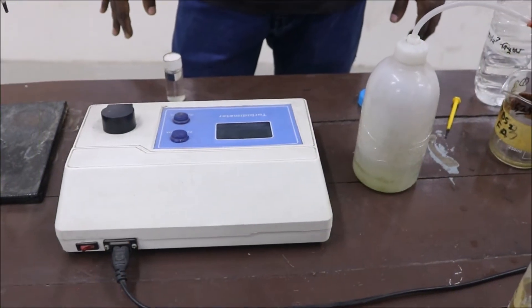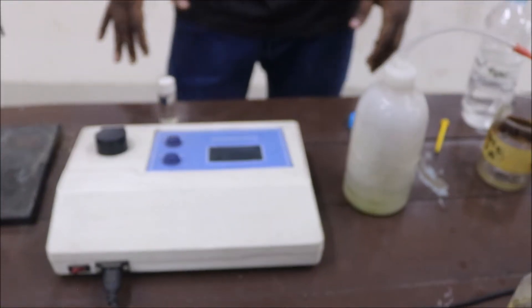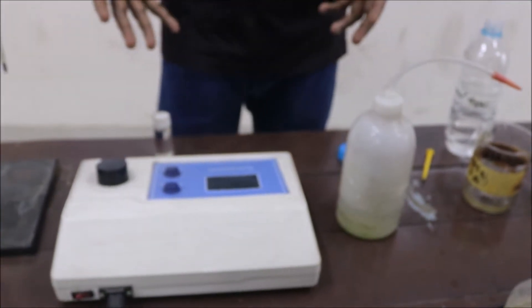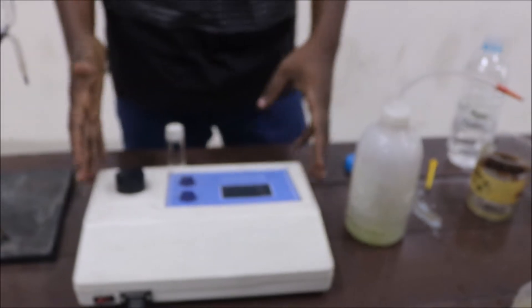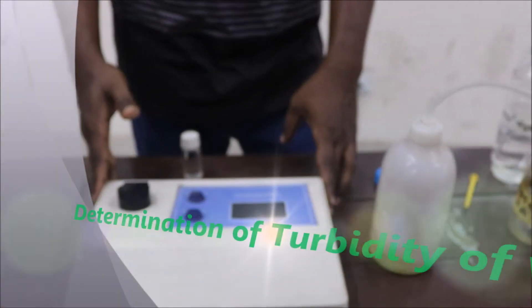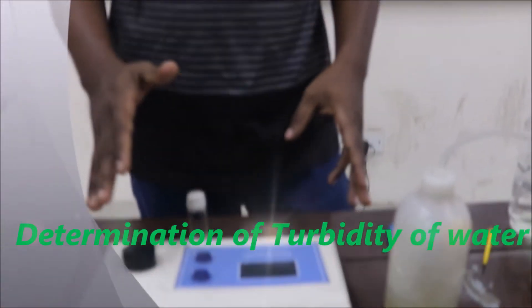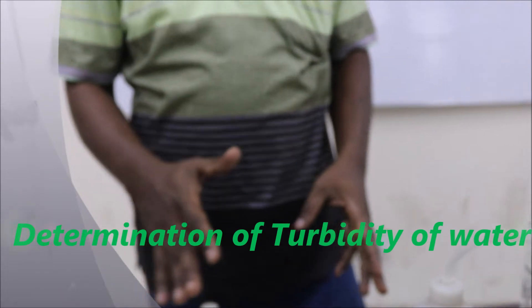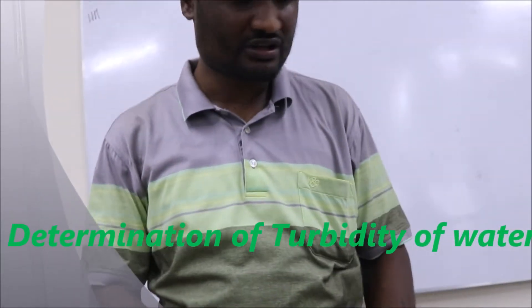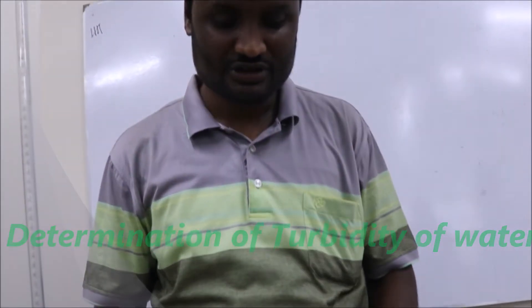Dear students, we will test the determination of the turbidity of the water.